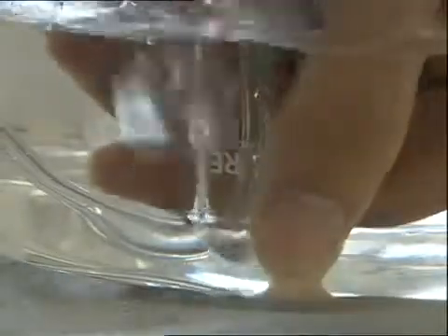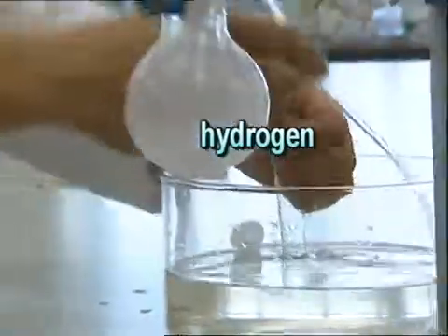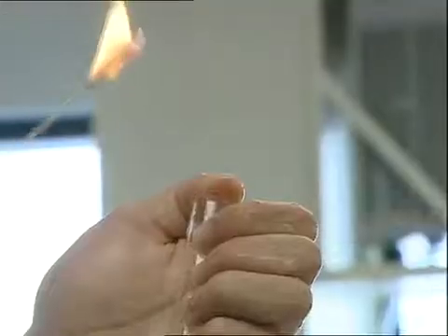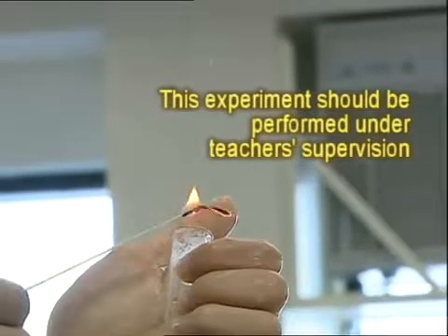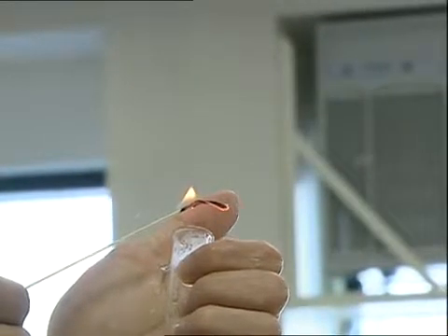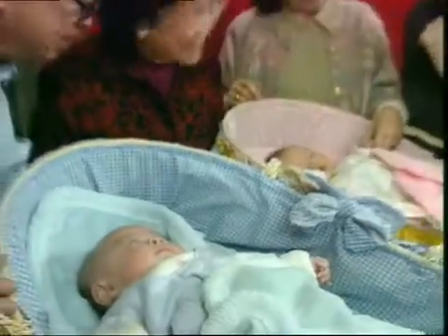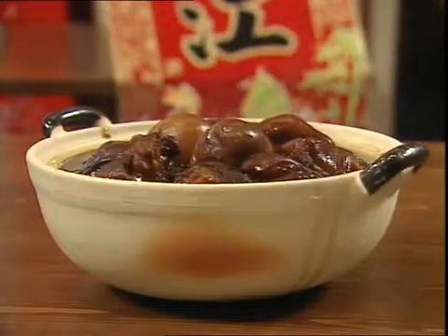Some metals react with dilute acids, releasing a colourless gas. This gas is hydrogen. Place a burning splint near the test tube and see if there's a pop sound — this is the method for testing for hydrogen. It is a Chinese tradition to cook ginger and pig trotters with vinegar to celebrate childbirth. Ceramic utensils are used for the cooking, as metallic utensils are not used because the acid in vinegar could corrode the metals.